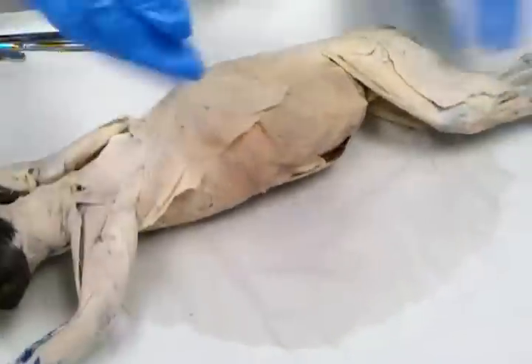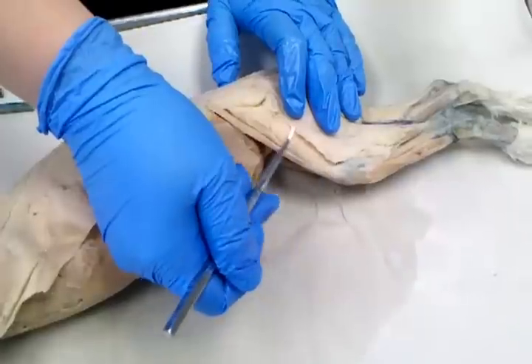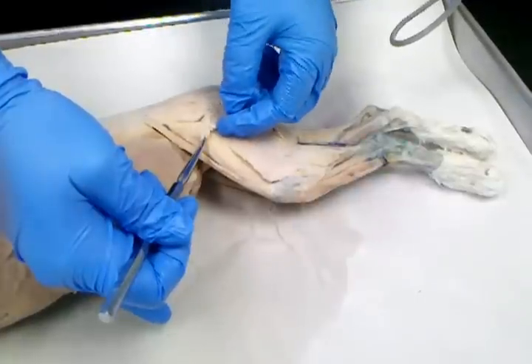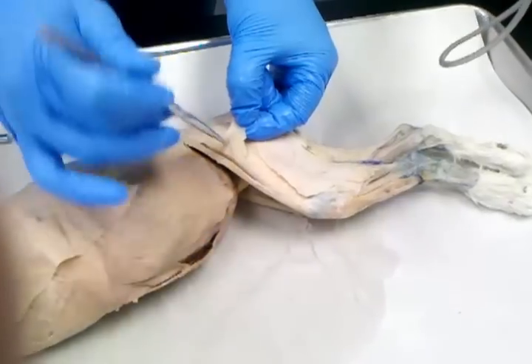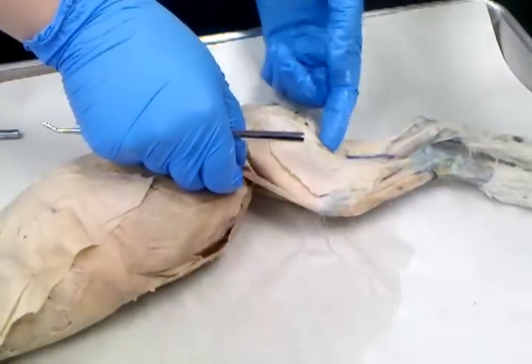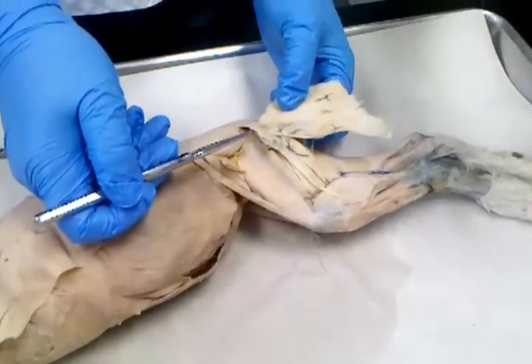Now the leg, okay? What's missing right here, where you can see the remnants of it, is fascia lata. It was the connective tissue covering that muscle right there. That is one of the connective tissues you need to know, okay? And what happens is fascia lata becomes tensor fascia lata, which is a muscle, okay? And you see it here, and it also runs up underneath here, okay? Now, the biggest muscle in the hind leg is the biceps femoris, okay? If I flip it back, this long skinny muscle right here is caudofemoralis.